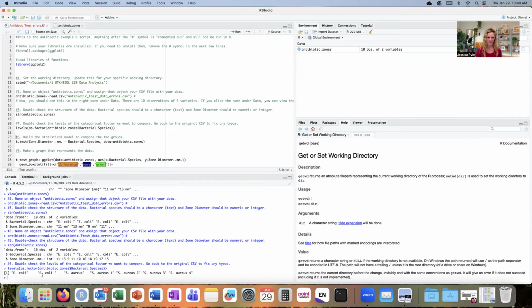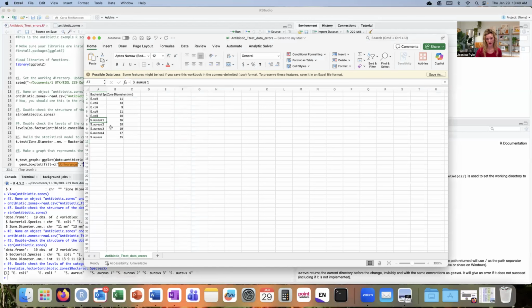There's also something happening with E. coli, and I see that there's no numbers associated with E. coli, but there's something else that's making it different and causing R to interpret there being more than 1 level of that category for E. coli. Let's start by deleting those numbers for staph because that's an obvious issue. I'm going to go into each one of those and delete it. I also want to make sure that there's no typos in that species name. If somebody misspelled aureus, then it would be interpreted as 2 different categories or 2 different levels in R.